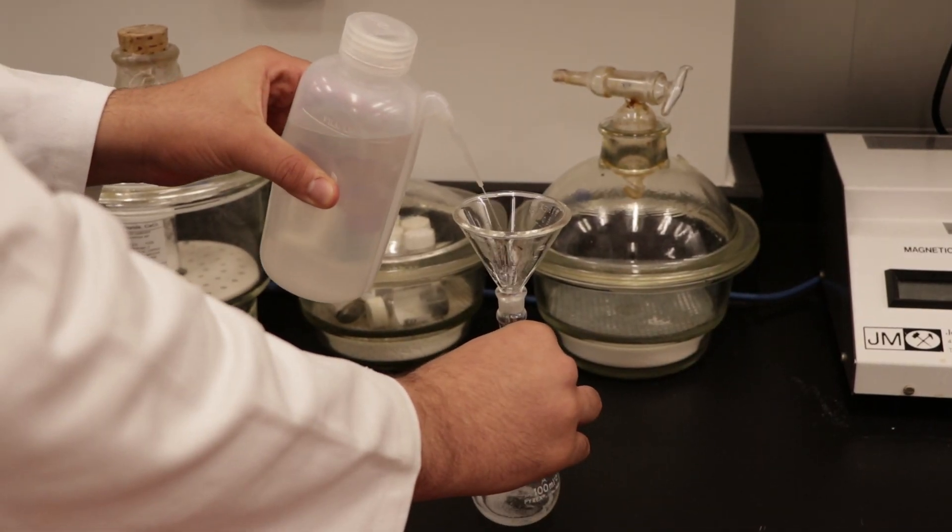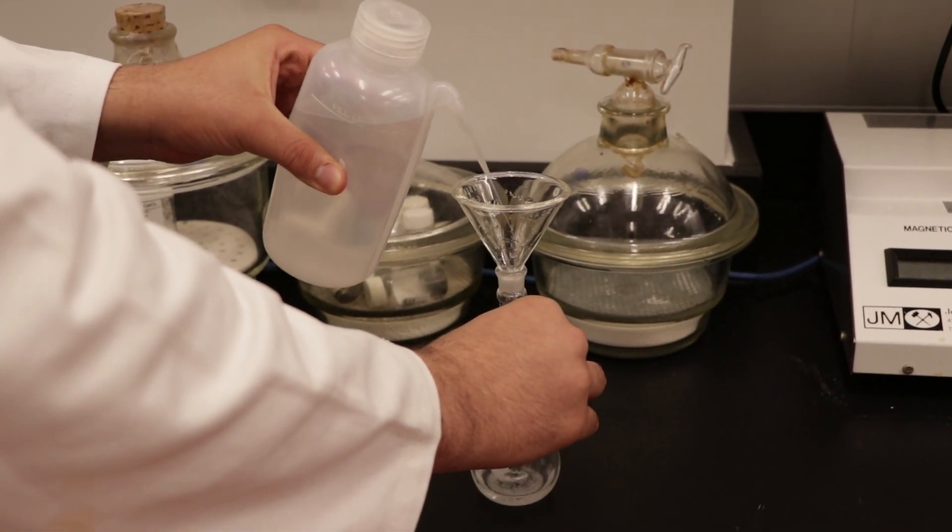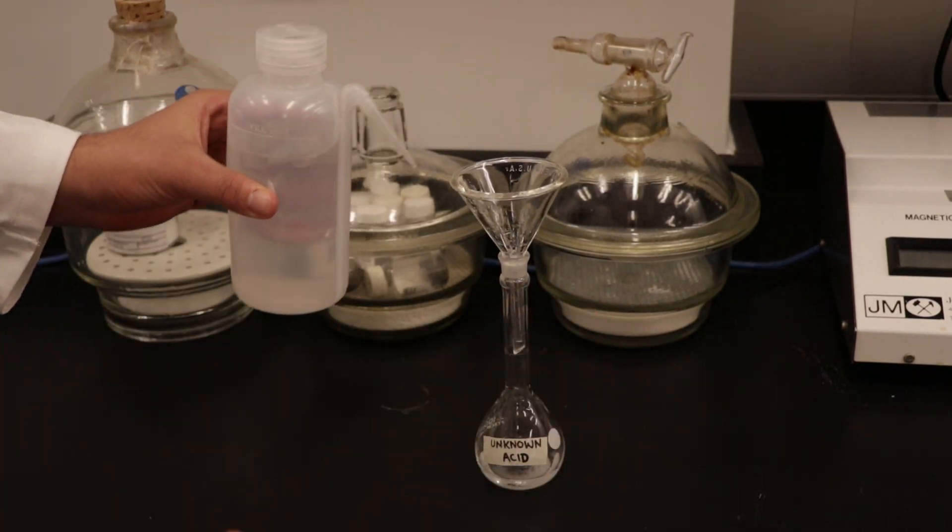At the opposite bench, wash down any powder adhering to the funnel with distilled water and bring everything back to your bench.